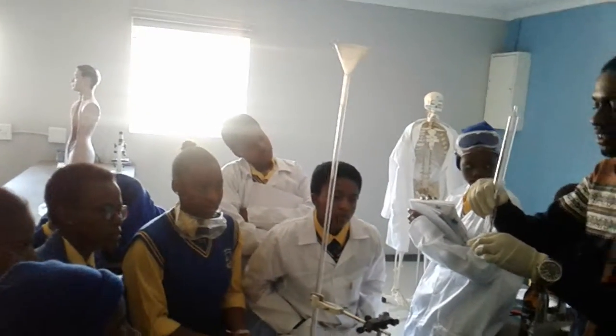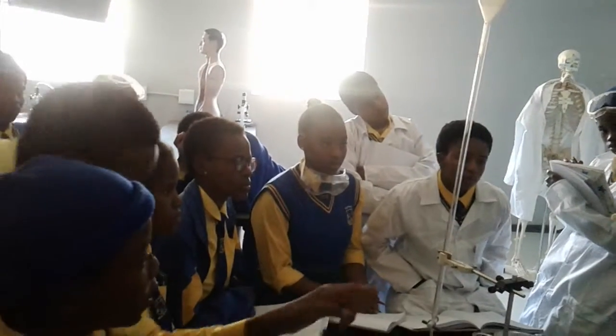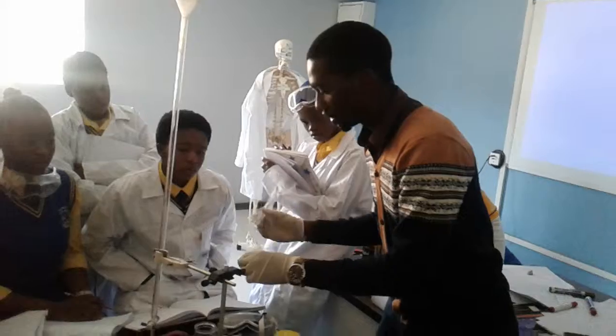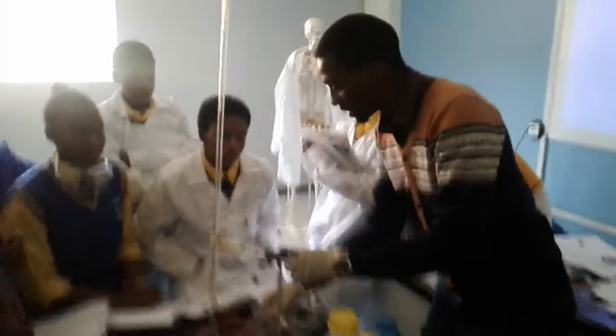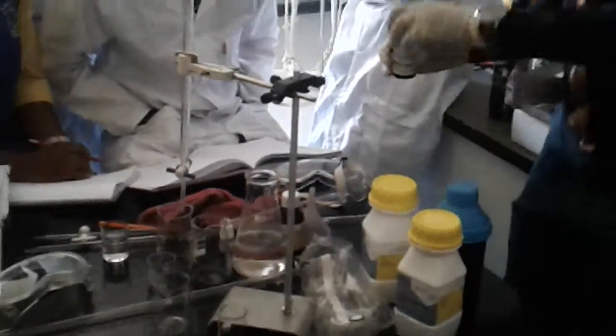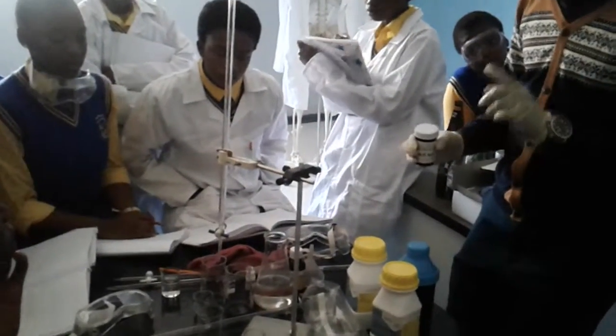Now here I'm just increasing the surface area. Right? So here I'm not increasing the kinetic energy. Now you see it has dissolved, but not completely, so it's weak. Alright. What did I add there? Oxalic acid. So this is just oxalic acid. This is oxalic acid in an aqueous solution.